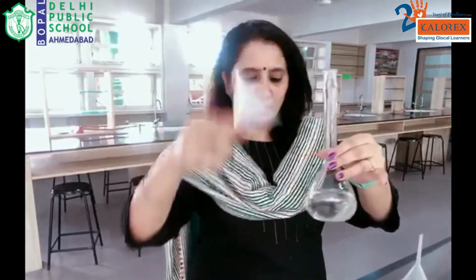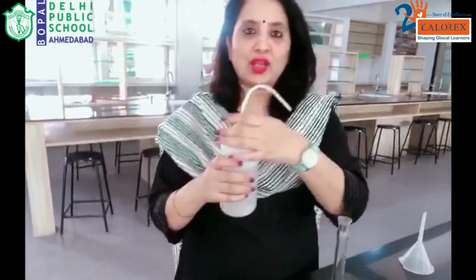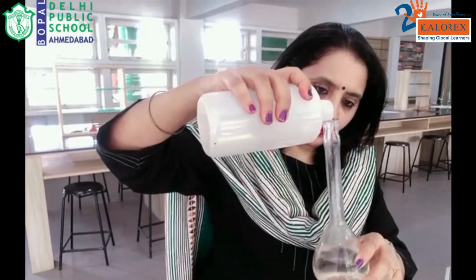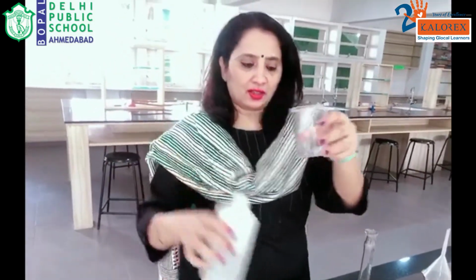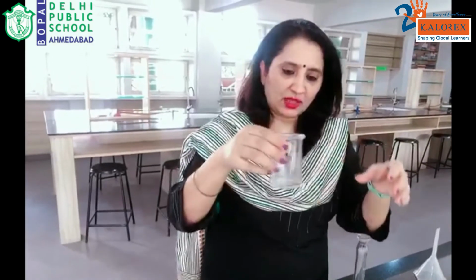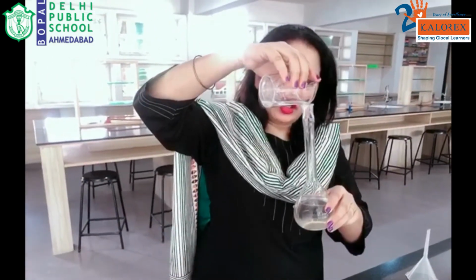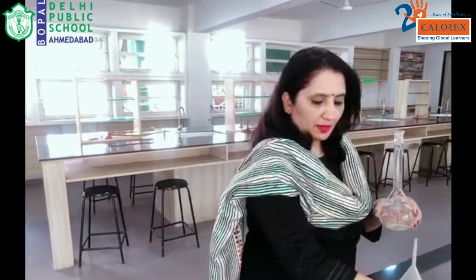Since it's only about 100 ml, I'll be putting enough water so as to make it 250 ml of M/20 oxalic acid solution. Also, care has to be taken that the beaker in which we dissolved all the crystals is thoroughly cleaned, so that no traces of the solution or the crystals remain in the beaker.